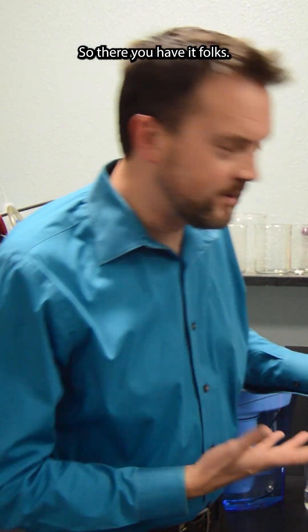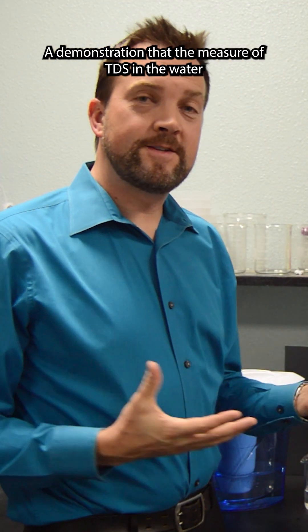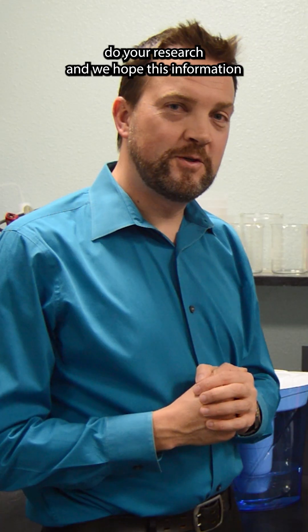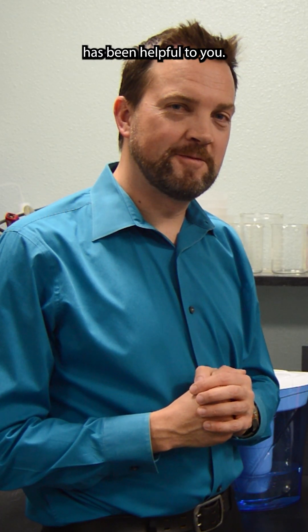So there you have it folks, a little demonstration that the measure of TDS in the water is not necessarily a measure of its safety or healthfulness. Do your research and we hope this information has been helpful to you.